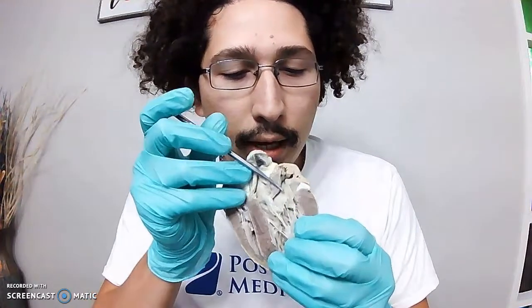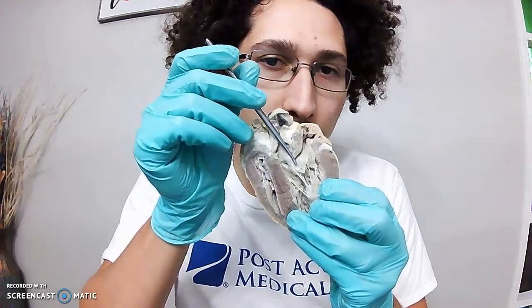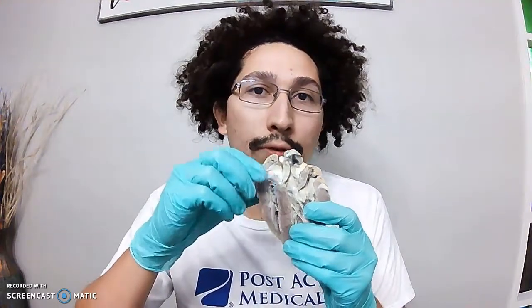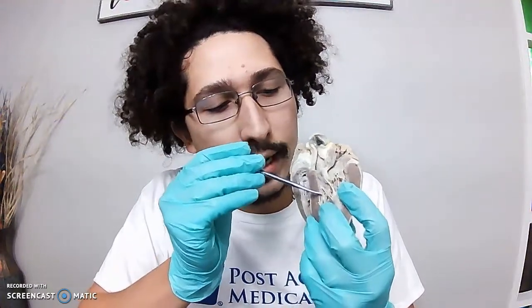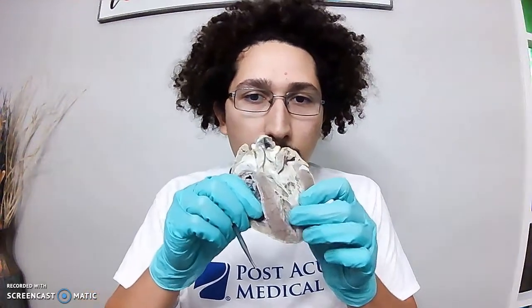That oxygenated blood goes through the mitral valve, right there, that little valve. Now mitral is derived from the word mitre, which is the formal headgear that the Catholic Pope wears, that pointy hat, or the bishops wear. That's where the name mitral valve came from, because I guess it kind of looks like a triangle. There are some chordae tendineae structures that hold that valve to the papillary muscles of the ventricle.